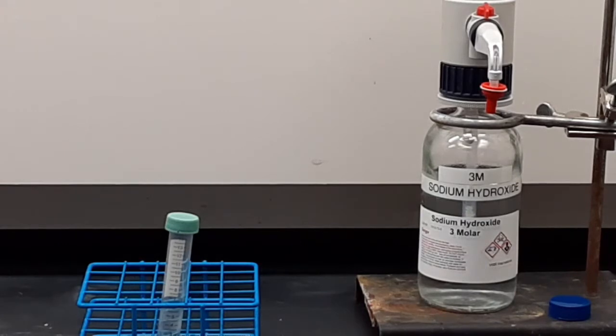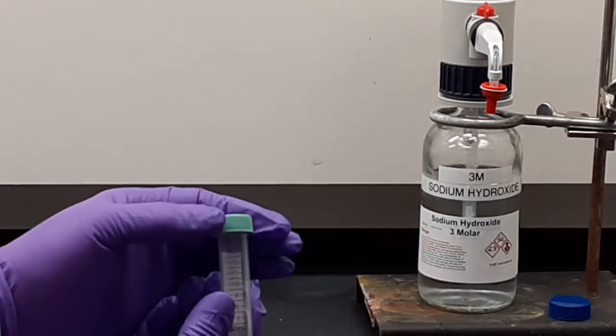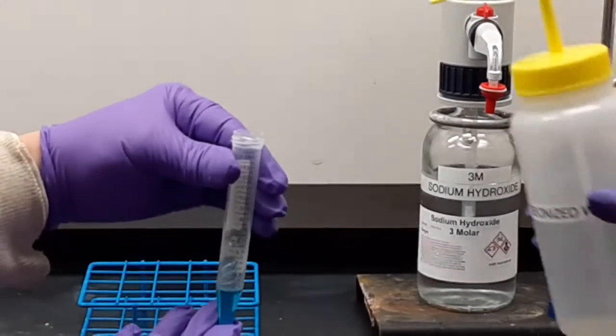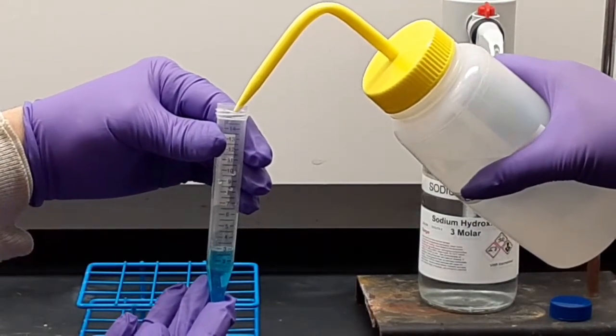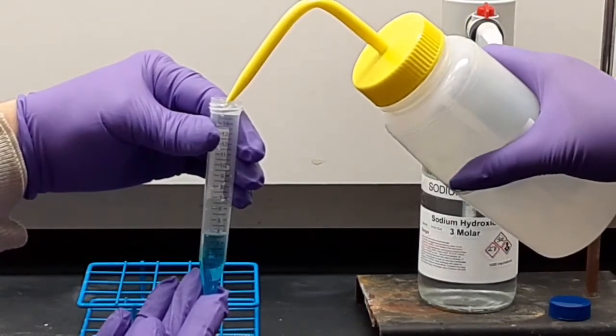Now, the first thing we're going to have to do here is add water up to the 4 milliliter mark with a water bottle. We should have done this in the hood, but we did not. You need to do this step in the hood. There will be a water bottle in the hood for you to use. You fill it up like that.